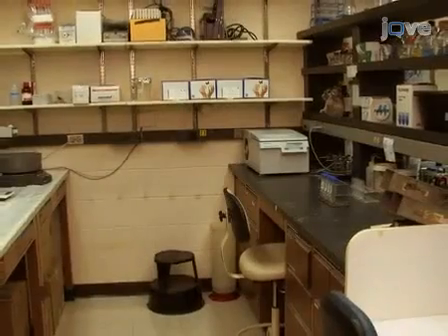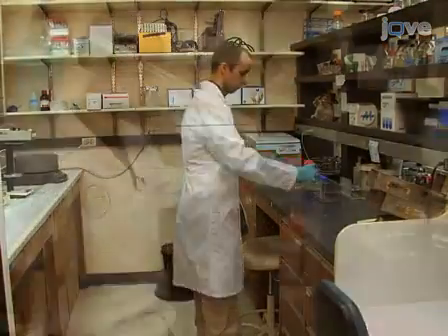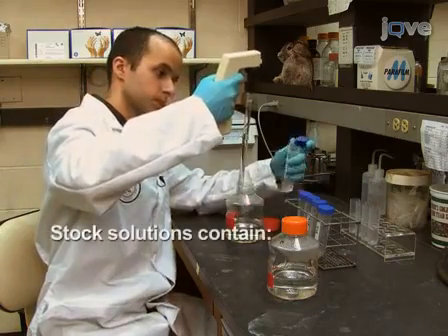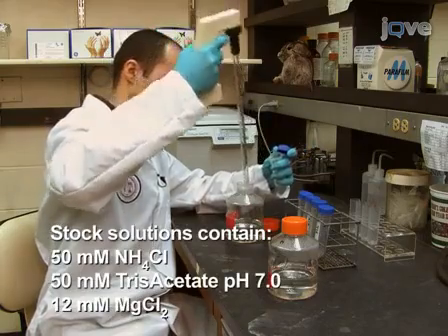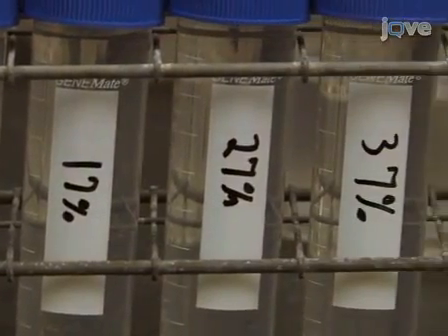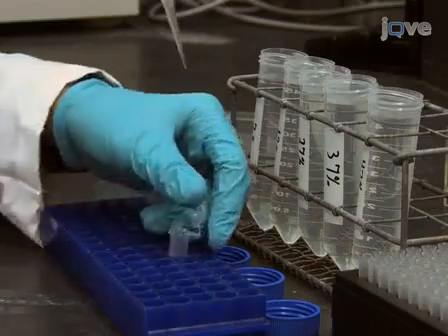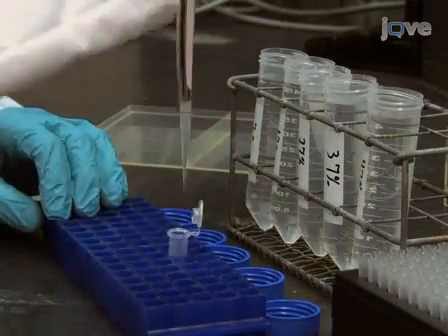Sucrose gradients should be prepared 1 day before use to allow gradients to become continuous. Mix the appropriate volumes of 7% and 47% sucrose stock solutions to make 48 milliliters of each of the following sucrose concentrations: 7%, 17%, 27%, 37%, and 47%. Add 1 molar DTT to each sucrose solution to a final concentration of 1 millimolar.